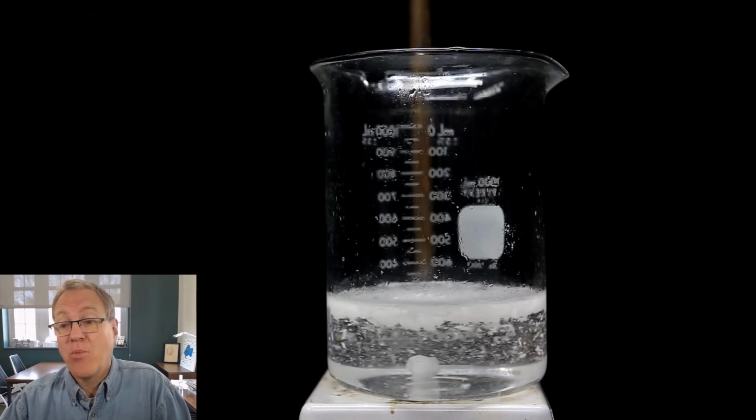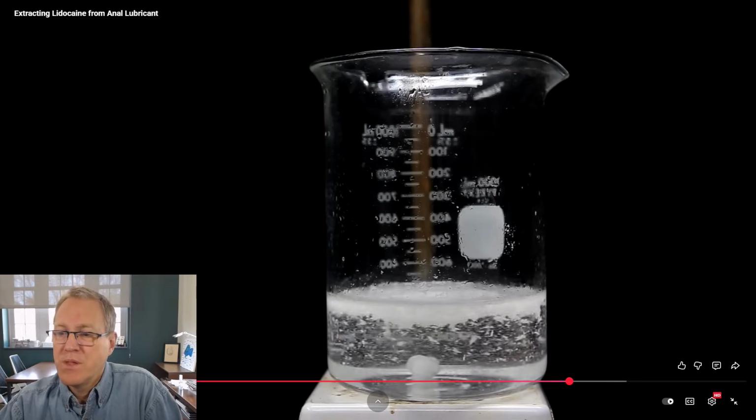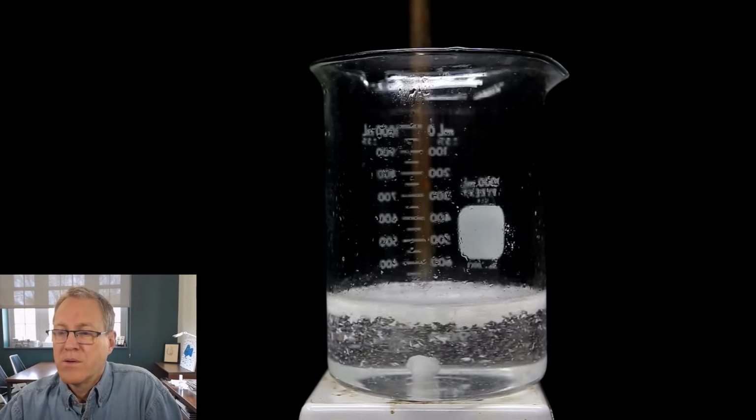And I just cut them off, and those do look nice. They look like nice plates. That's a nice looking product. With this large addition, we're left with a relatively clear solution with a lot of crystals floating at the top.